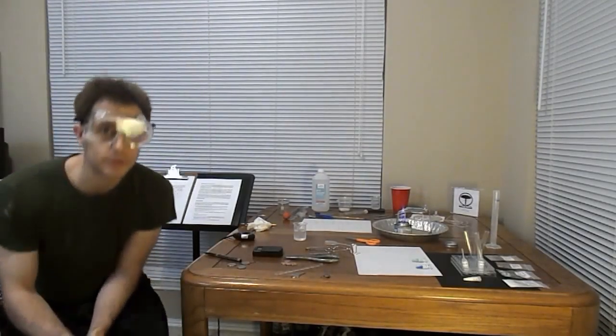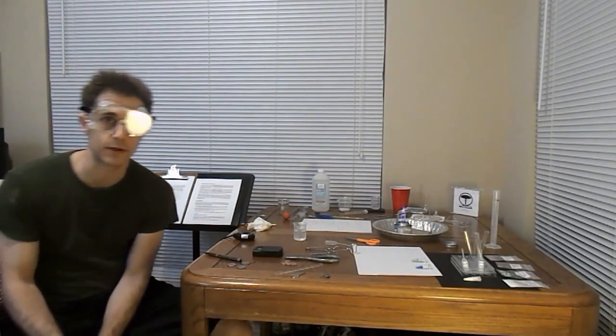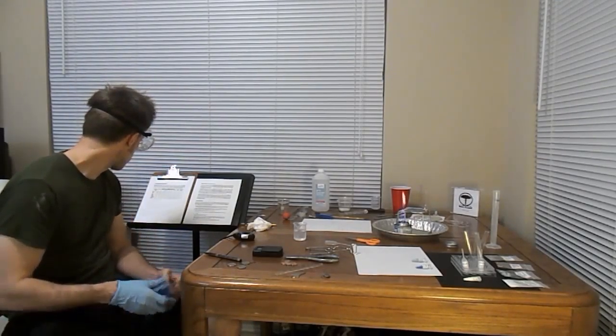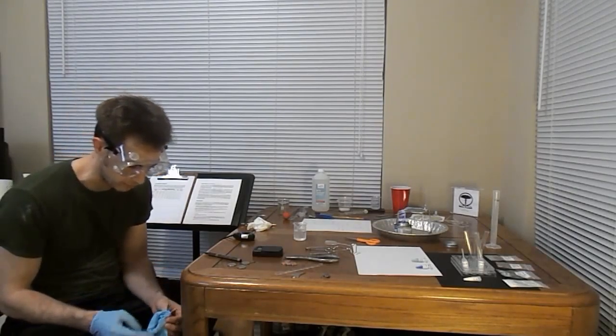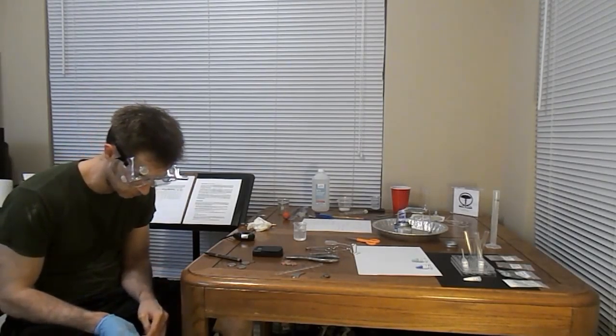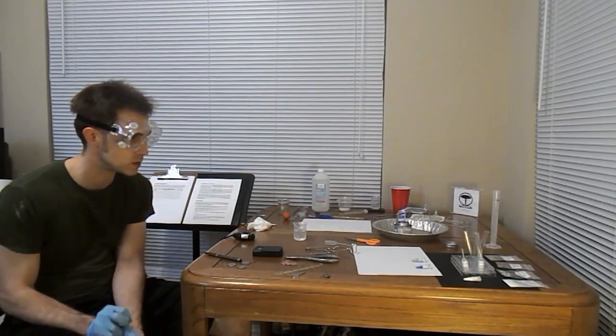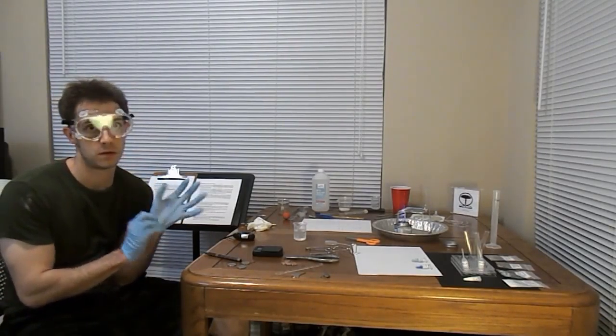Alright, in Lab 2 we'll be looking at the differences between chemical changes and physical changes, hopefully. Got a slightly different lab kit here than apparently I should have, so off we go.